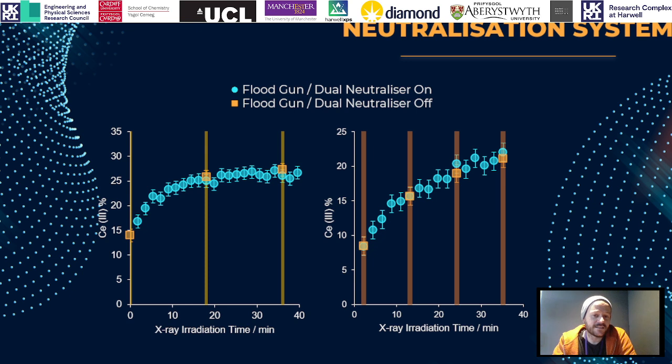What we can see in this case is when we plot our snapshots, where we've been running with the neutralization system off and then just turned it on for a single scan, these lie on exactly the same axis as when we just run the entire scan with the flood gun on. So we can be confident in this scenario that our neutralization system isn't doing anything to our ceria. This is just X-ray reduction. But it's just another thing to think about. If you are noticing some kind of sample damage, it might also be the neutralization system, not just the X-rays.